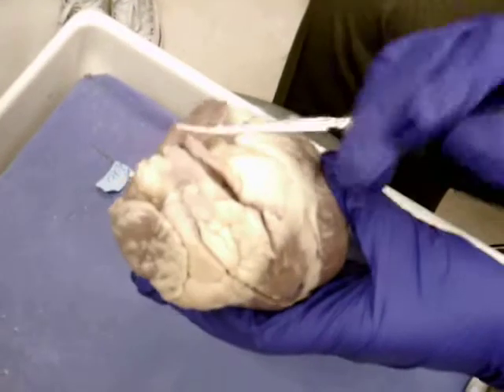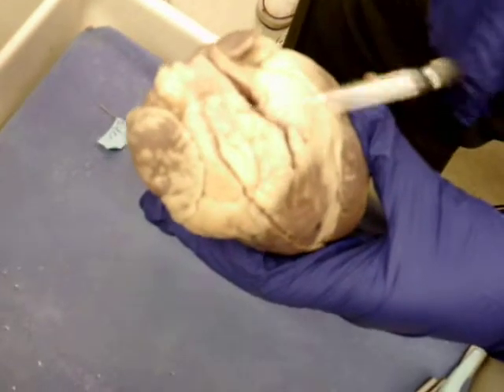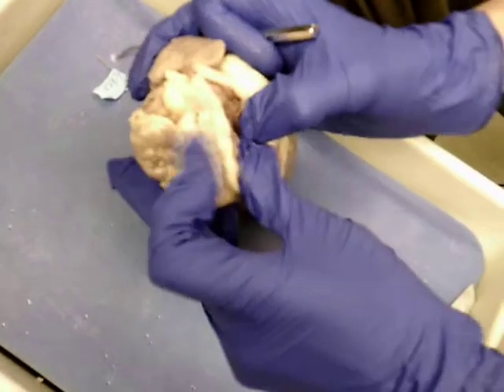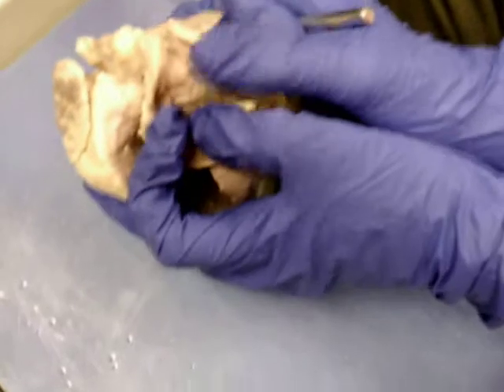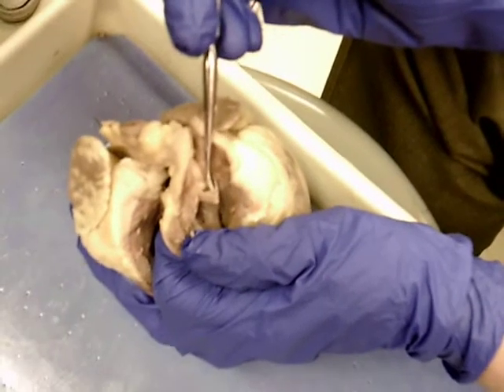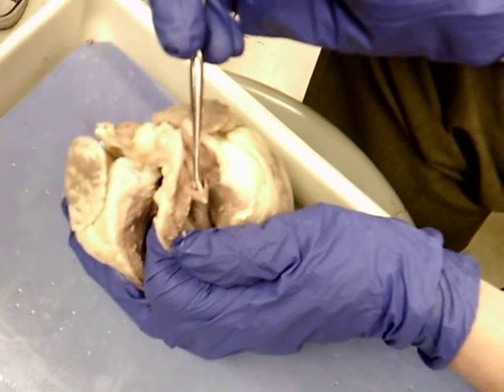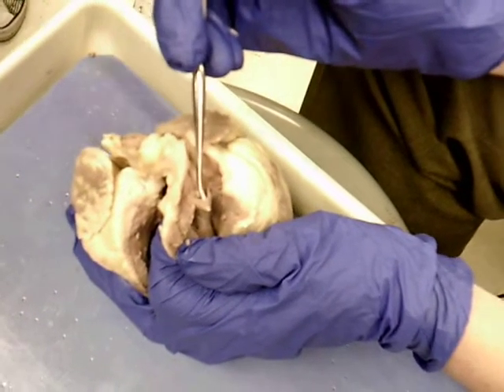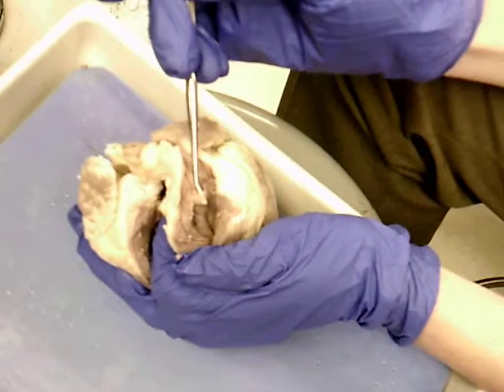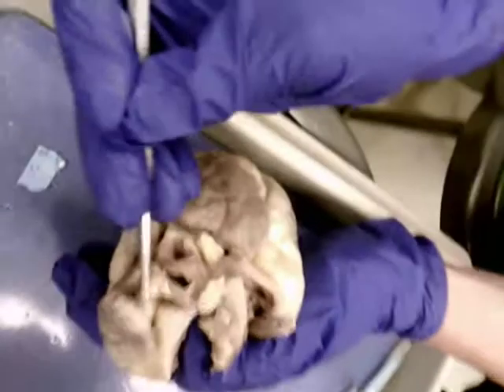So if I close it back like a clamshell, this must be the anterior side of the heart. And to get to the pulmonary trunk and see the pulmonary semilunar valve, I have to cut through this anterior wall of the myocardium. And if I do that, and open that slice up, I can see here's a cusp of the pulmonary semilunar valve. No strings attached, and I know it's a cusp-like valve, so it has to be a semilunar valve, but this is on the right side of the heart. Okay? And here's another auricle. And here is the right auricle for the right atrium.